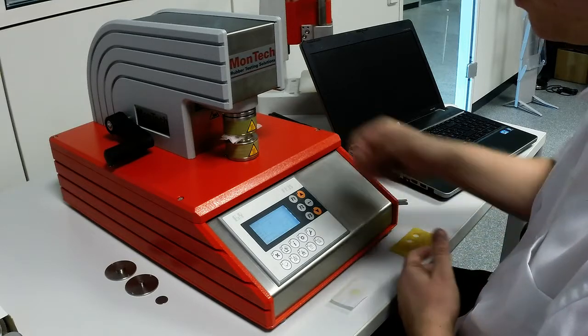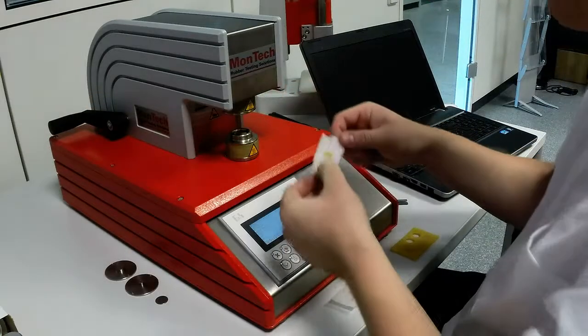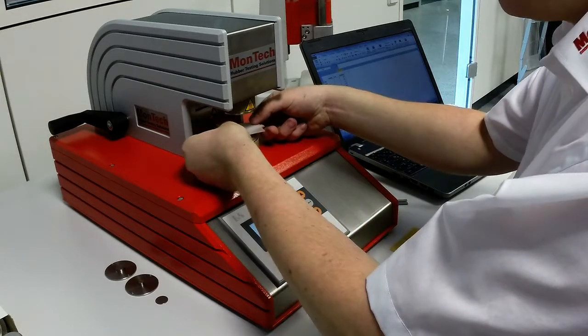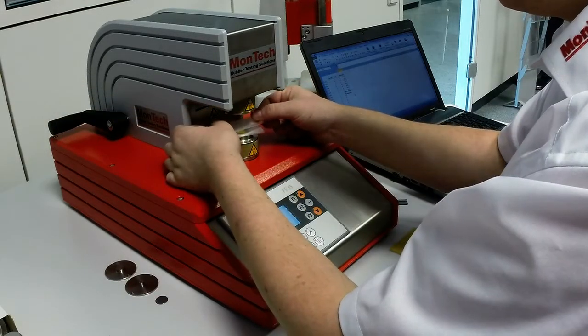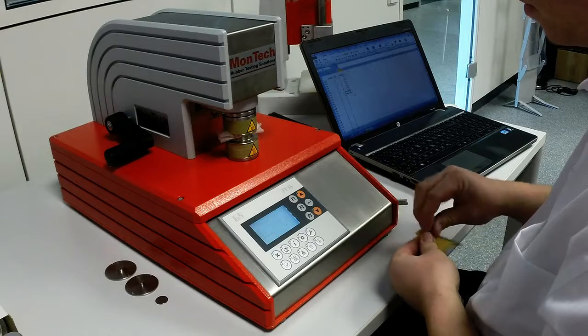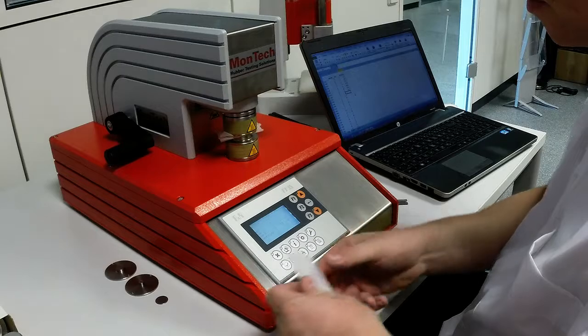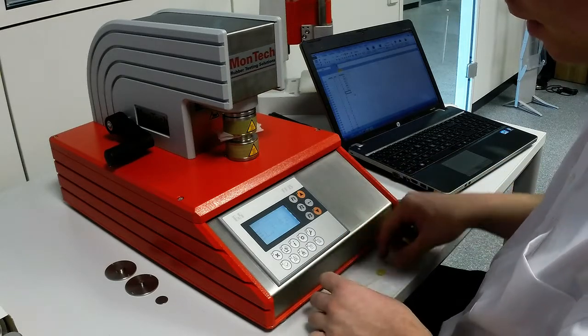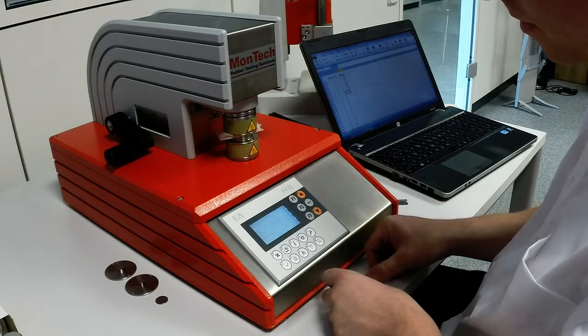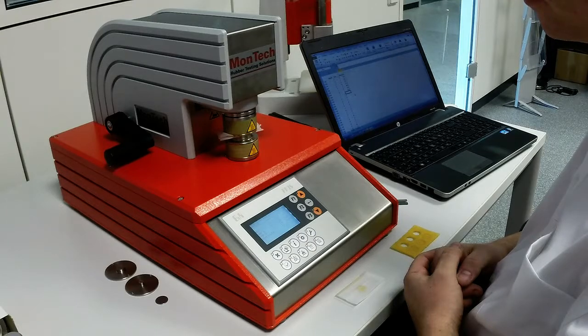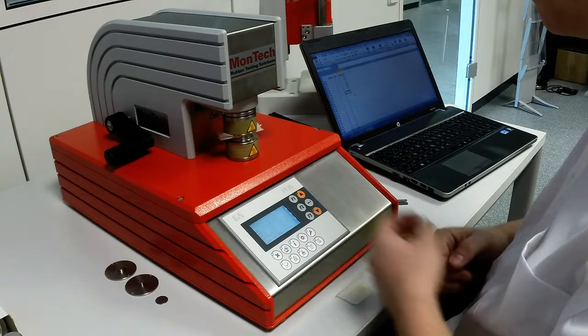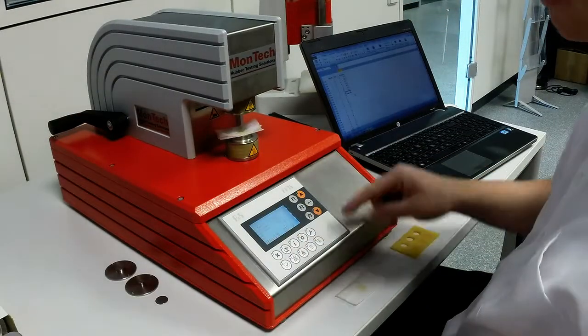Final result: 35.9. Next sample. Insert. Close. Standard grade cigarette paper is used as separation paper. Final result: 35.8. The final result is displayed in the control panel.